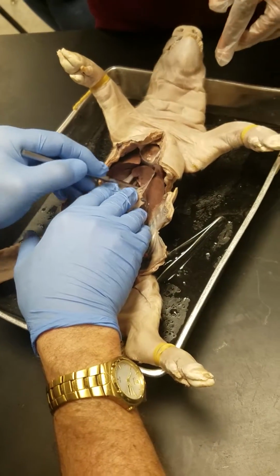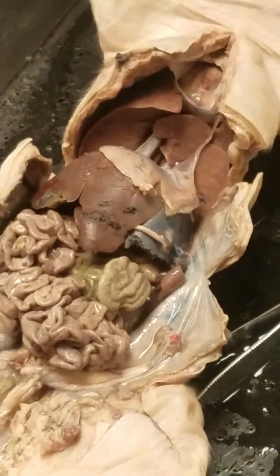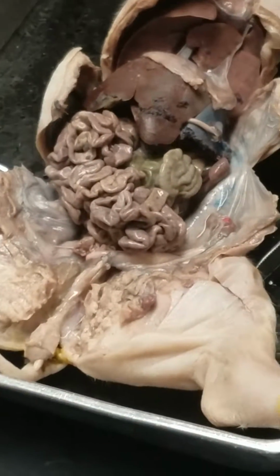And then if you wanted to, your aorta would be right there. All right. So lovely body of pig. The uterus, I just want, I won't ask body of the uterus. You won't ask that.